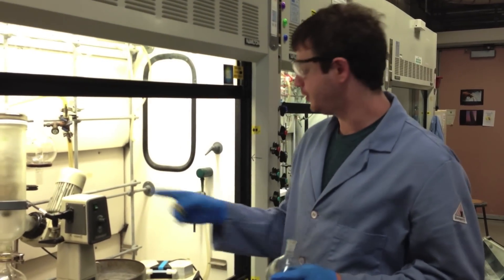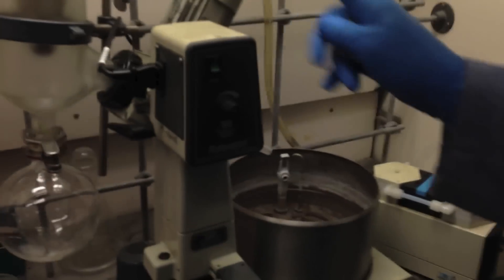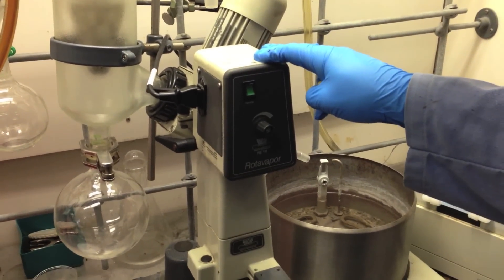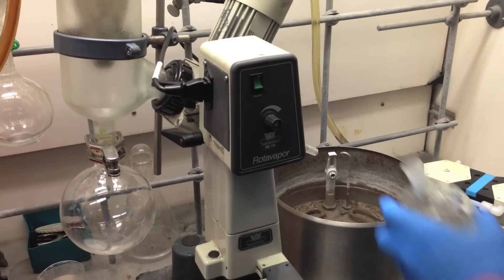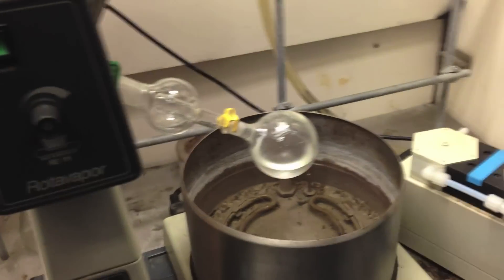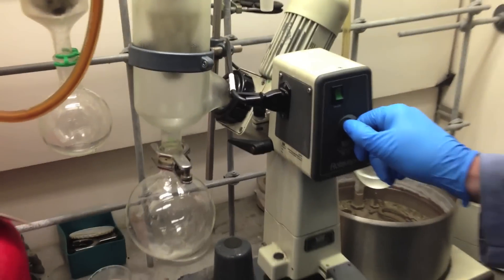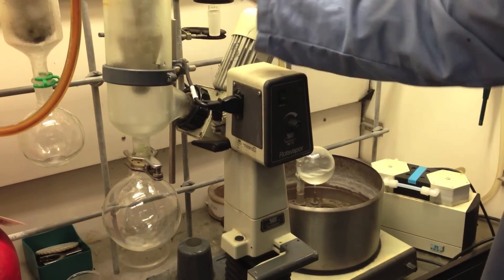Now we're ready to remove the pentane, and for that we'll use our good old friend, the rotary evaporator — a Roto-Vap. This is an old Roto-Vap that we've recently refitted with a new motor, but it does get the job done. You put the flask down here, flip it in place, then turn on the vacuum. The pressure inside the entire system will be reduced and the pentane is going to distill onto the cold finger.